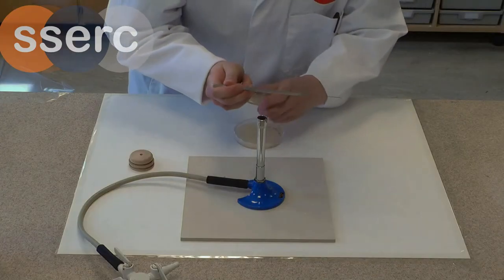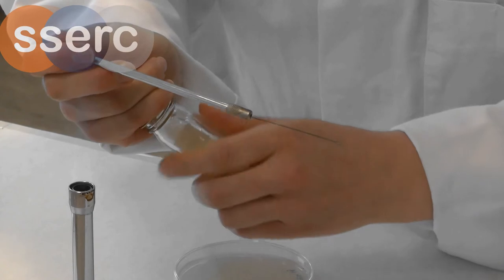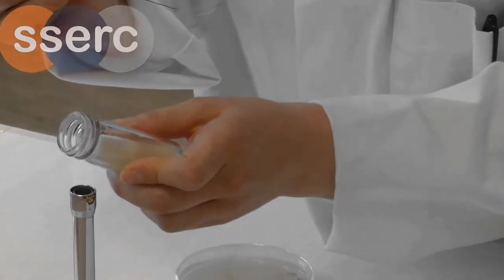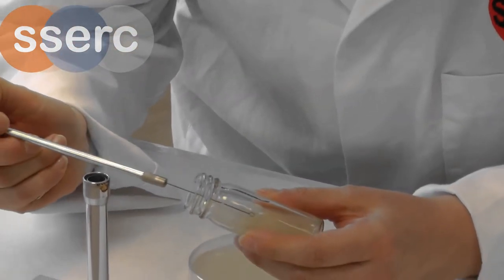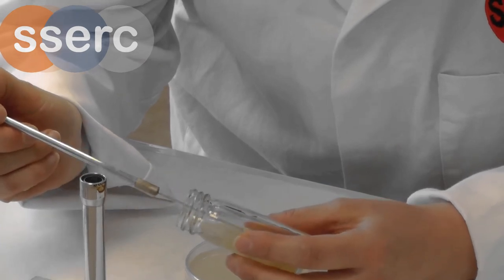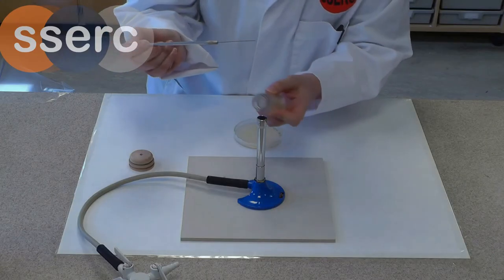Using your pinky palm technique remove the lid from your slope, flame the neck, pick up a little piece of culture.